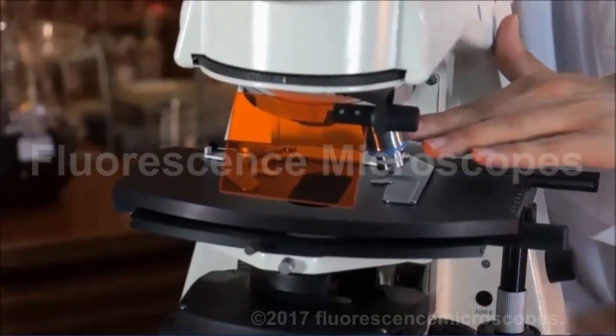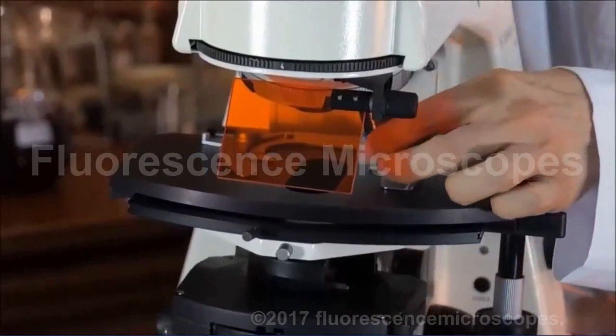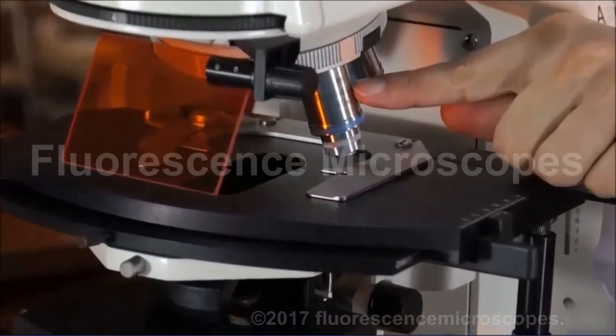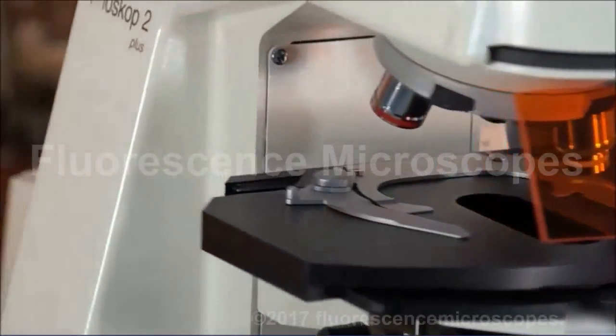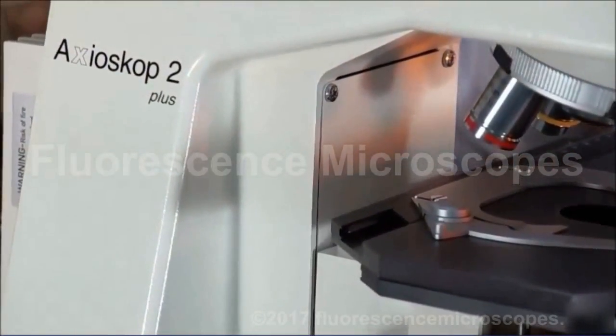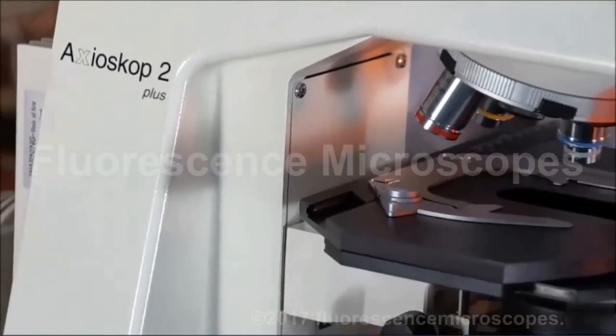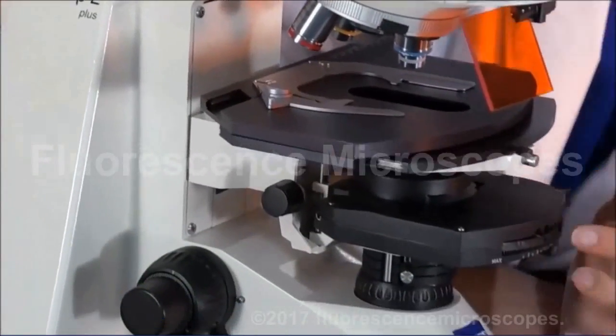So in this case you're going to want, since this says phase 2 on it, there's a PH2 on this 40X, so you're going to want to turn that to the number 2 button. Right there.